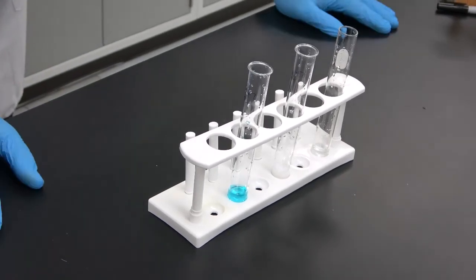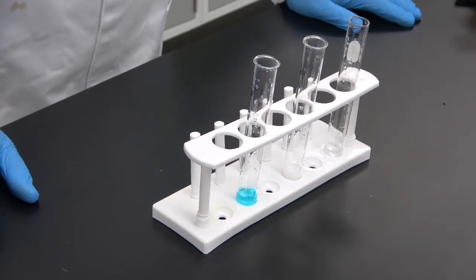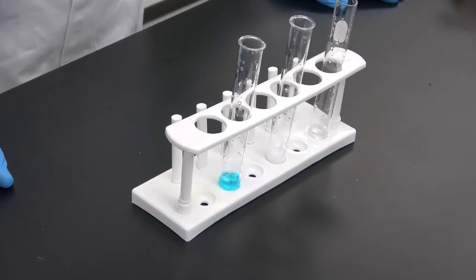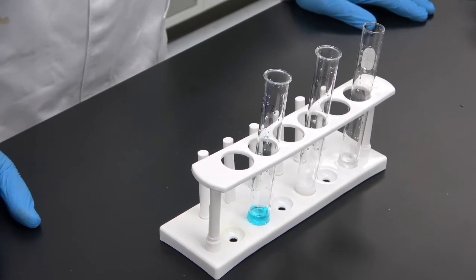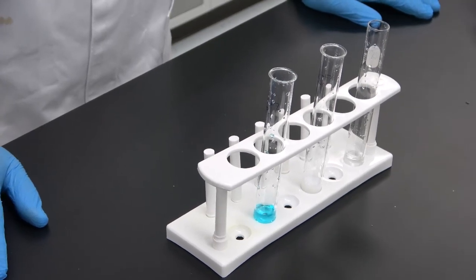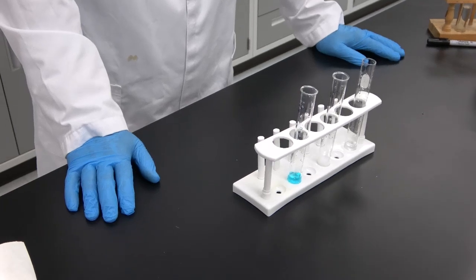Next, what you have to do is to put together the pieces of this puzzle and identify each one of the 3 unknowns. And that will be the end for today's lab. Remember, you have to write now your lab report and hand it in by the due date that is posted in the calendar in Blackboard.